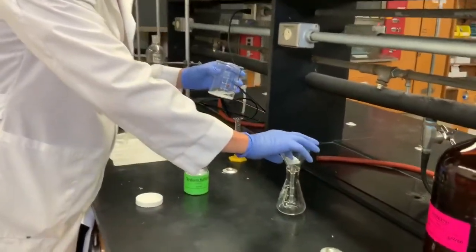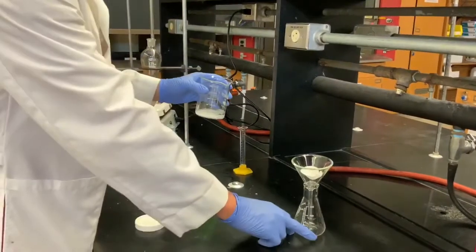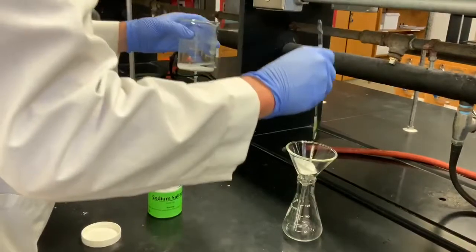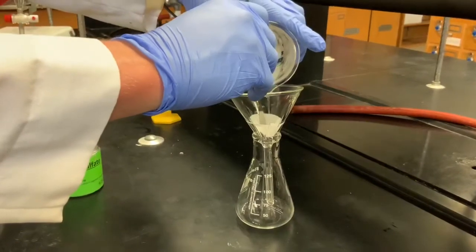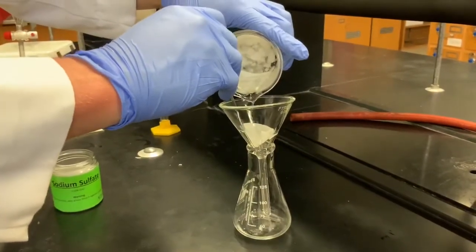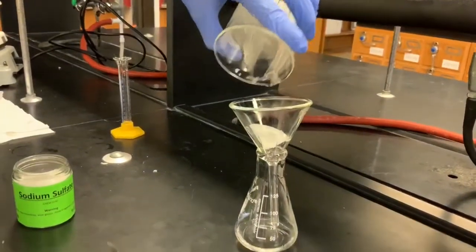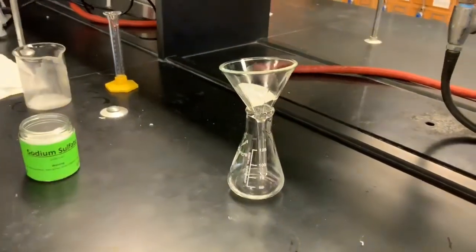We're going to use a simple gravity filtration — this filter paper is just to catch any floating pieces of sodium sulfate — and collect all of our product below. The filter paper is folded so that it fits nicely into the funnel to stop any solid going inside. We now have camphor dissolved in the ether.